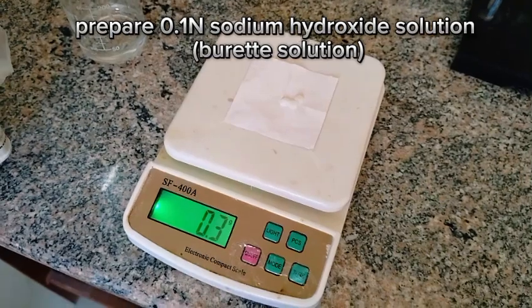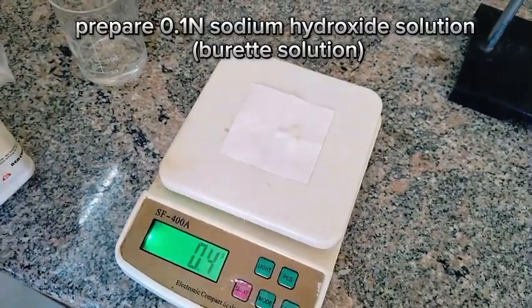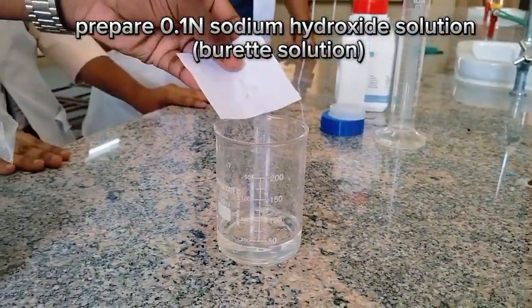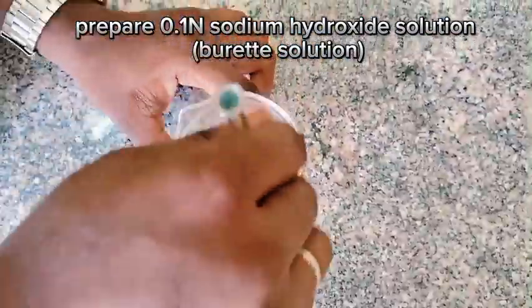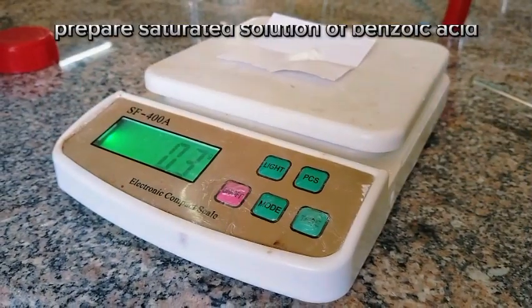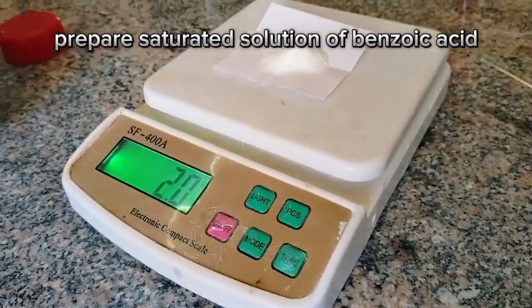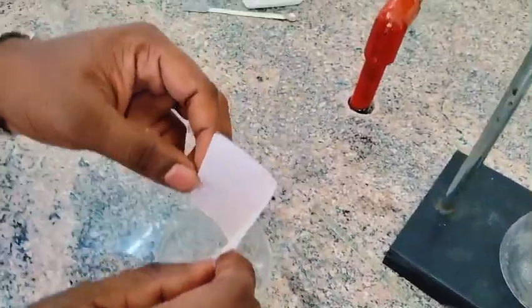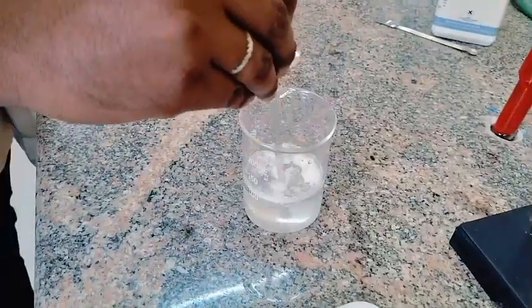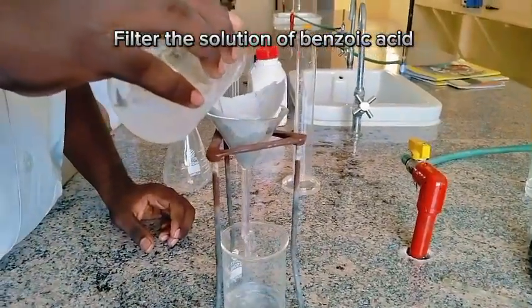Prepare 0.1 N sodium hydroxide solution. Prepare saturated solution of benzoic acid. Filter the solution of benzoic acid.